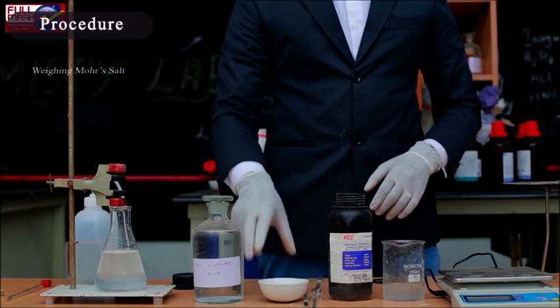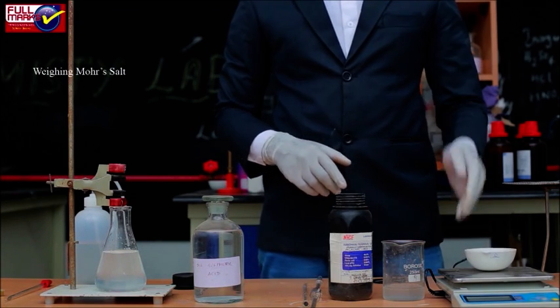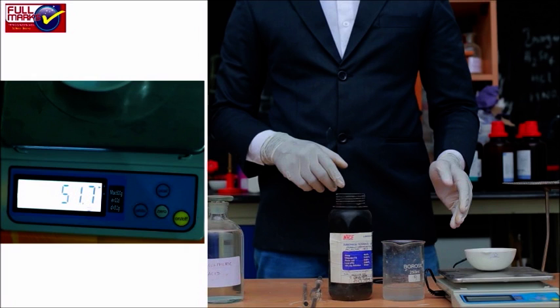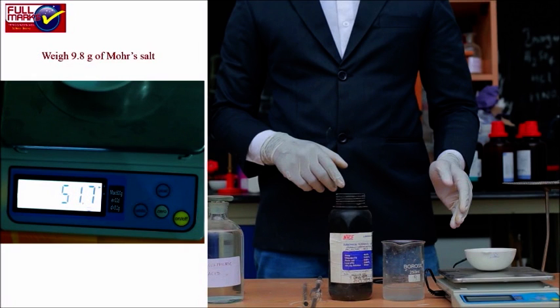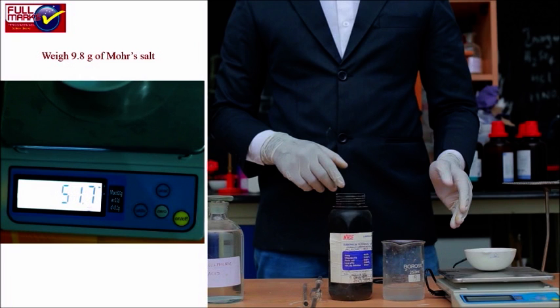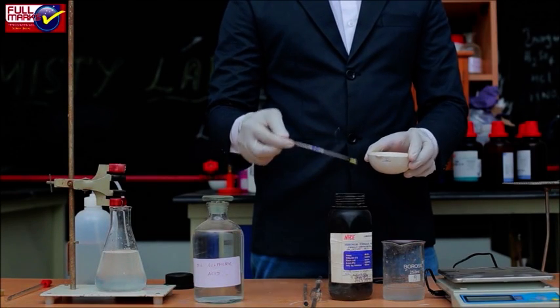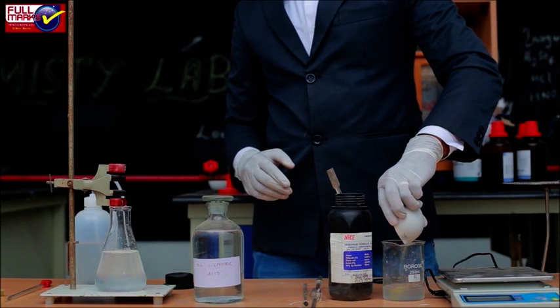Procedure - Weighing Mohr's Salt: First, take the weight of a clean and dry watch glass using a chemical balance. Weigh 9.8 grams of Mohr's salt on the watch glass. Take the difference between the total weight and the weight of the watch glass; this gives the weight of Mohr's salt. Transferring Mohr's Salt: Carefully transfer the Mohr's salt from the watch glass into a clean beaker.